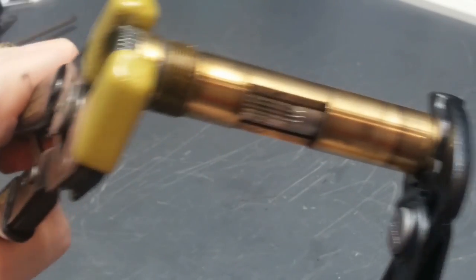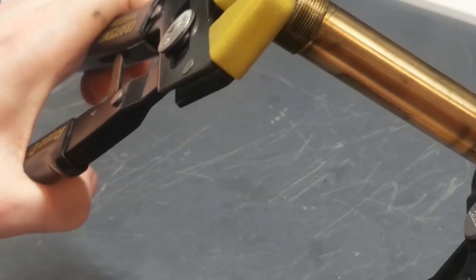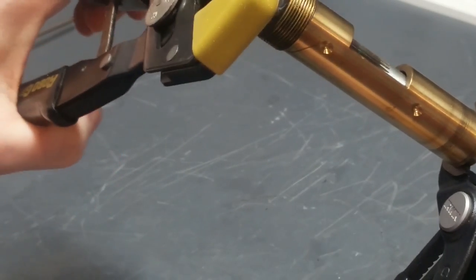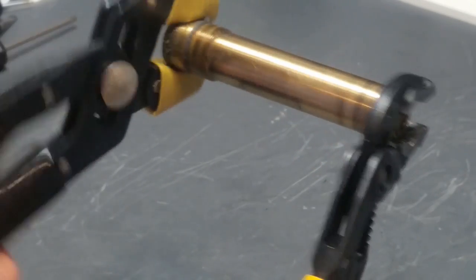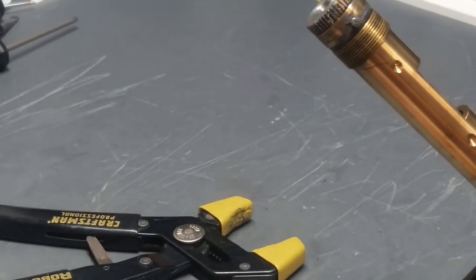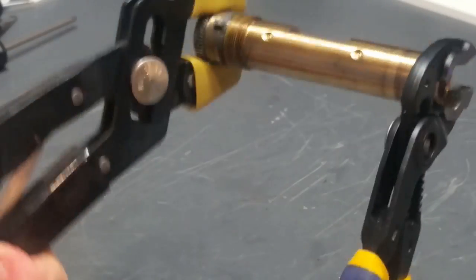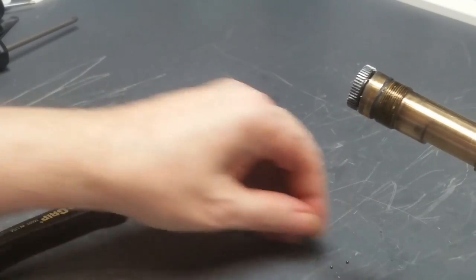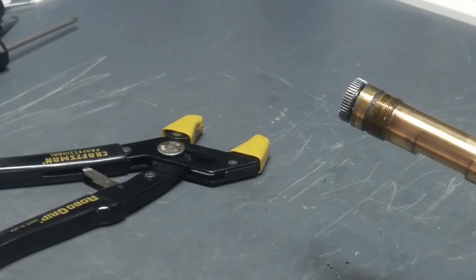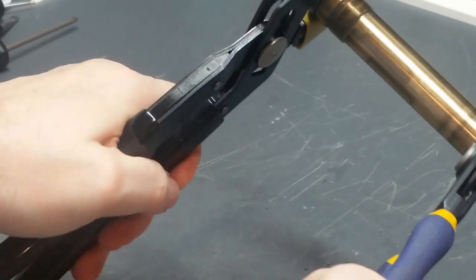And the gears want to slip because it takes a lot of force to get these guys to go sometimes. Eventually, you get to the point where it does go. It takes a lot of work. It is loosening. It just takes a while. Still fairly stiff. That's pretty typical of these things. And I'm starting to get little bearing balls dropping out of here because I'm starting to get a gap here. So I want to kind of contain those so that when they fall out, I'm able to find them.